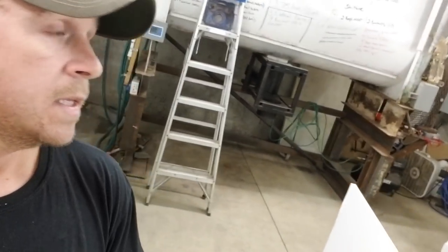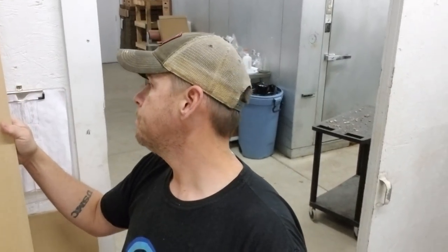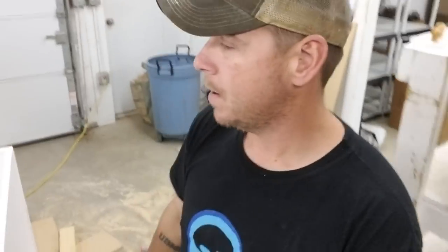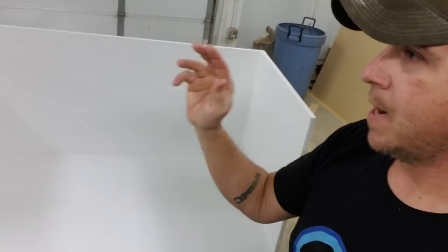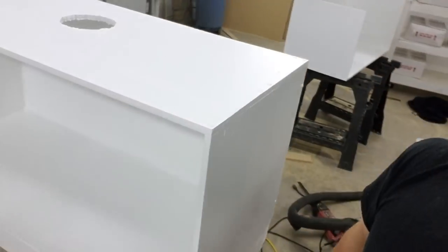It's not rocket science to build a hood or a filter. I'm not a carpenter, but I can mangle one together. I am using particle board - I think it's called MDF. You can get it at Lowe's, Home Depot, or any of the lumber yards. This is half inch - you can do half inch or three quarters. Make sure you use pilot holes or screws will go right through it. Basically, you're just building the cabinet.